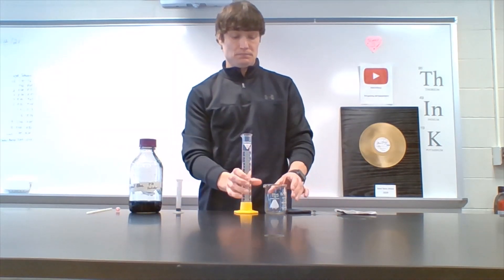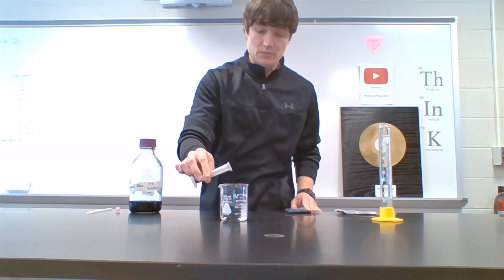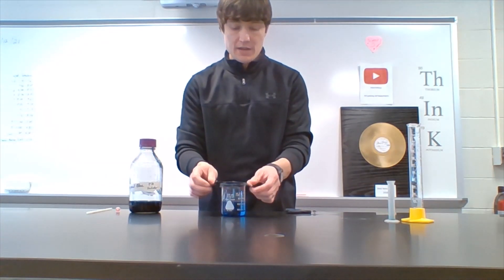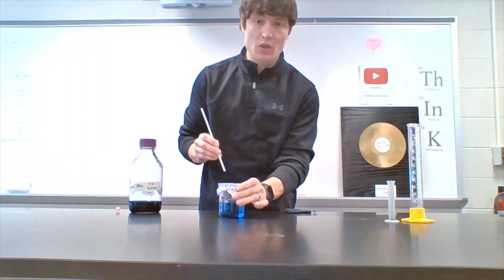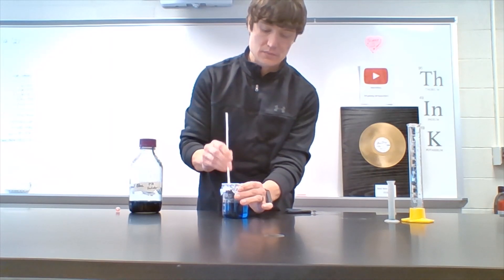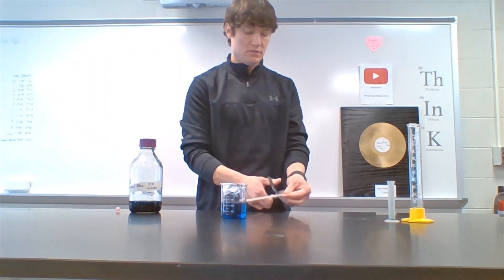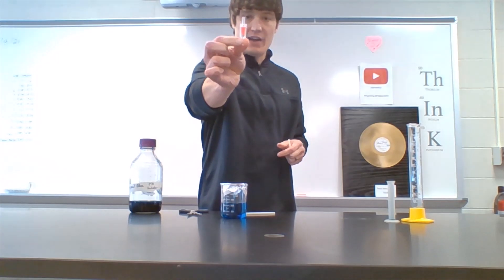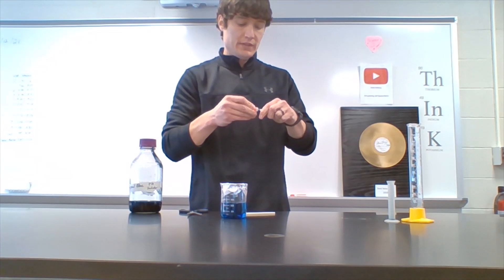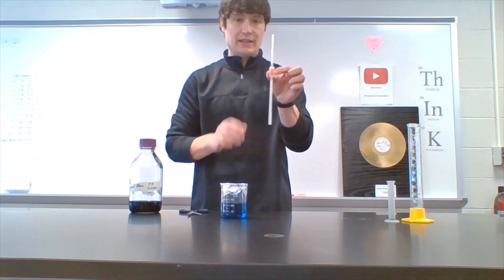Here's what we're gonna do: 115 ml in the beaker, pH indicator also in the beaker, aluminum foil goes over the beaker. I'm gonna use my straw to poke two holes in the top of the aluminum foil on opposite sides of the beaker. I'll ensure that the little arrow is pointing down on my valve, then stick one side here on the straw and stick the other side on like this.